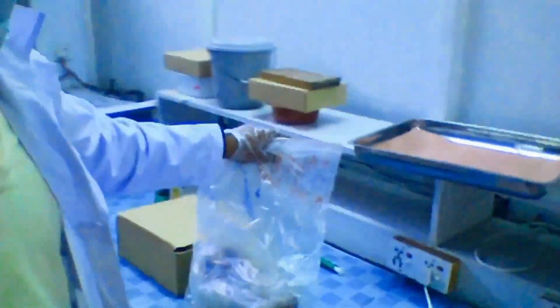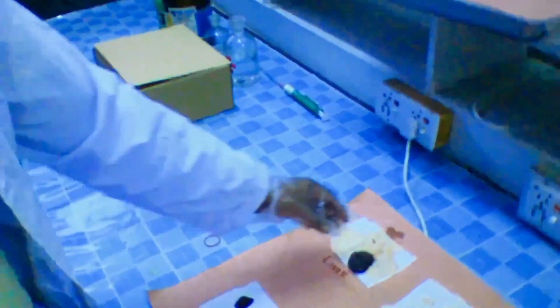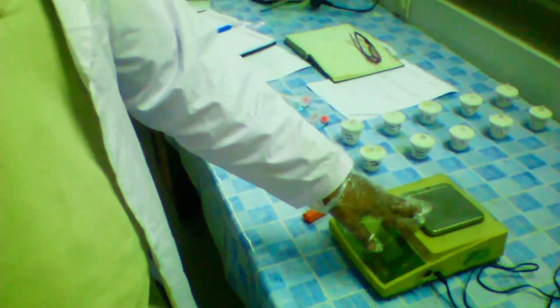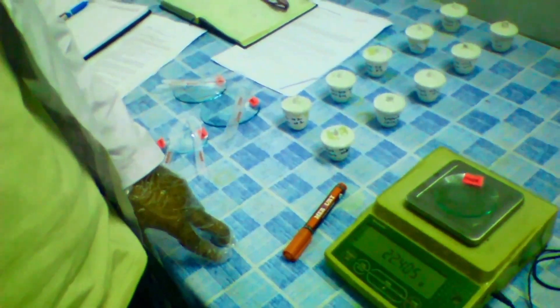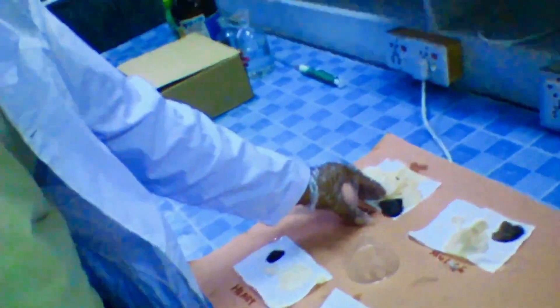These were my specimens. I worked on that while here, so I got the specimens out. These are the dissected specimens — I got each organ and each tissue in separate plastic bags. After dissection I froze those organs in the refrigerator, and I have to thaw them at room temperature so the acid digestion process can be done. Switch on the scale, see if everything is working all right. First I have to weigh the specimens and all the organs and make sure that the required amount is added for the heating process for digestion. I note all the weights of all the specimens because these are later used to calculate the amount of heavy metals per gram of tissue.